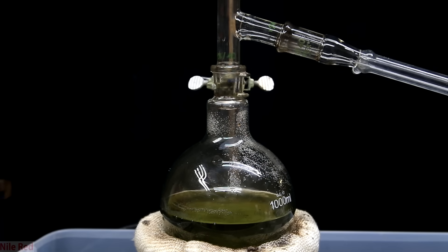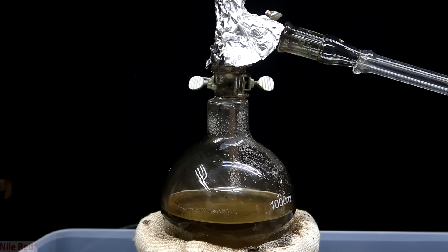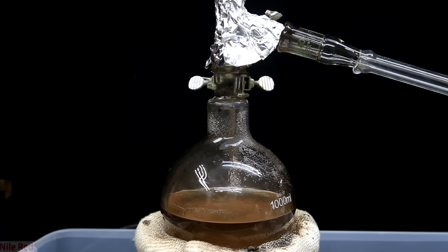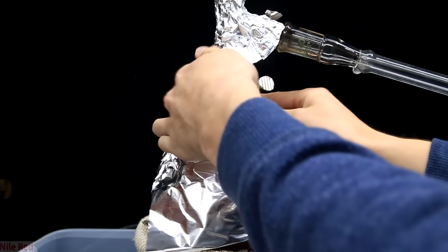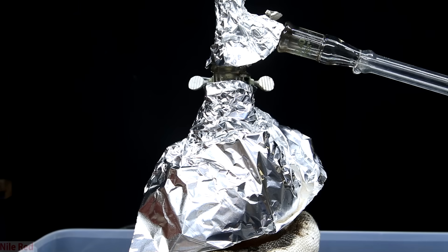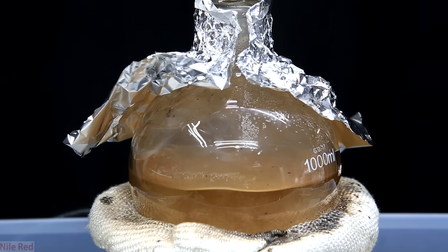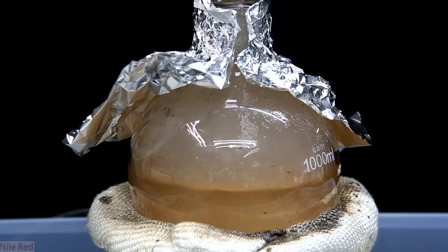I heated the flask using an electronic heating mantle, and shortly after heating it the color started to change. Hot sulfuric acid on its own is able to oxidize carbon all the way to CO2. This is why I said earlier I didn't think the hydrogen peroxide method was really worth it — because we're going to be heating it anyway, and it will probably oxidize the inhibitors to CO2 without the addition of peroxide. I also found an extremely important part for the distillation is to insulate everything using aluminum foil, because without insulation it's actually pretty hard for the sulfuric acid to make it over to the condenser.